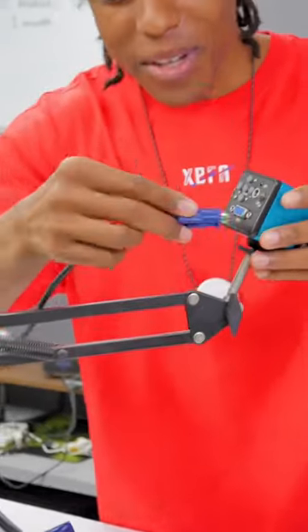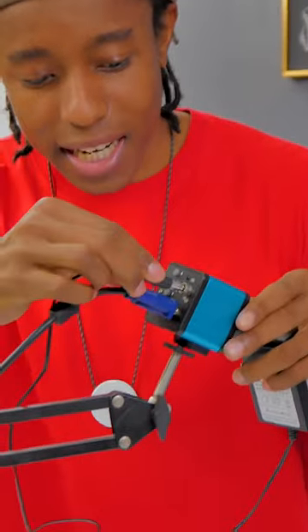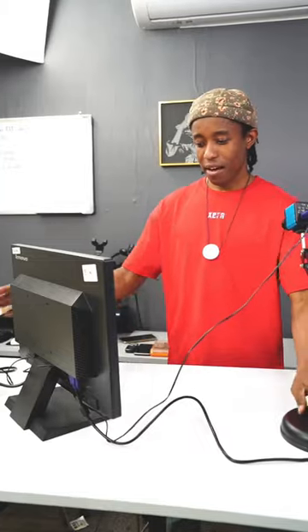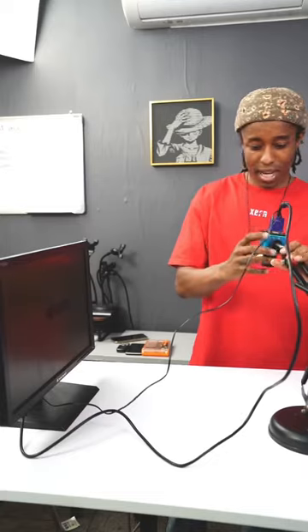Let's connect that and see how we can assemble it. Connect your microscope to the top — we're using the cheaper alternative here. Connect the VGA cable and power cable, plug it in, connect the monitor VGA cable the same way, and power is on. We have a picture and you can point this to the table easily.